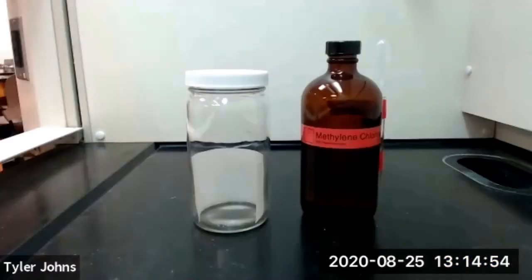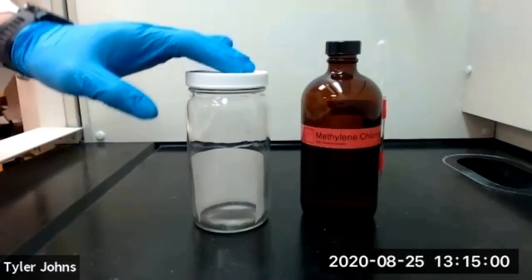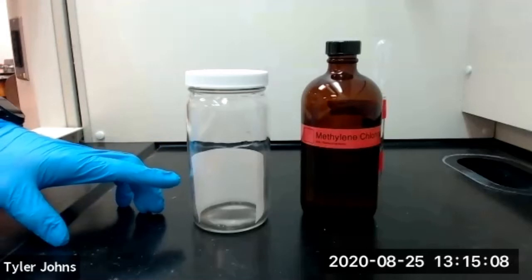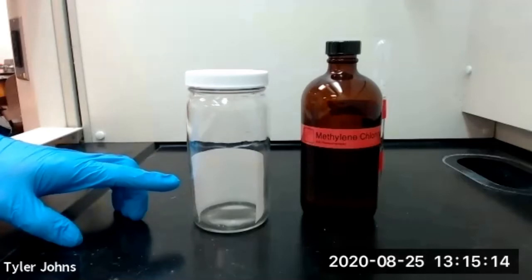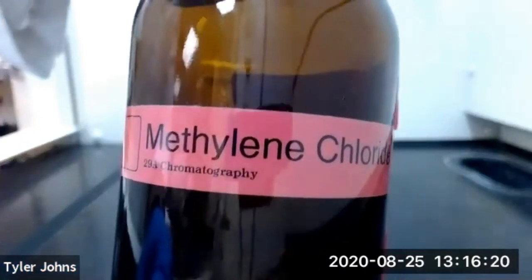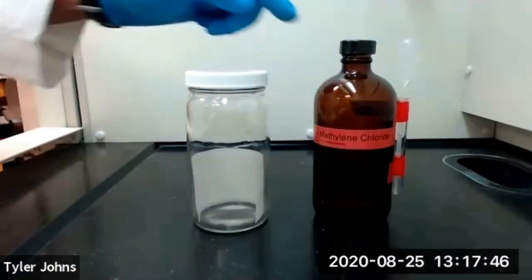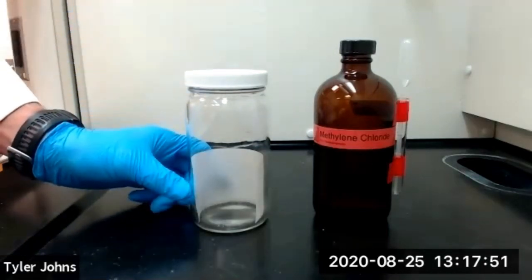After spotting all of our samples on our TLC plate, we need to prepare a development chamber. The first thing we need to do is place a piece of filter paper to serve as a liner inside of our development chamber. Once moistened with our solvent, the filter paper liner will help saturate the development chamber with our solvent vapors. The solvent that we will be using for this experiment is methylene chloride. We're going to transfer approximately five milliliters of methylene chloride to our development chamber while making sure to completely saturate our filter paper with the methylene chloride.